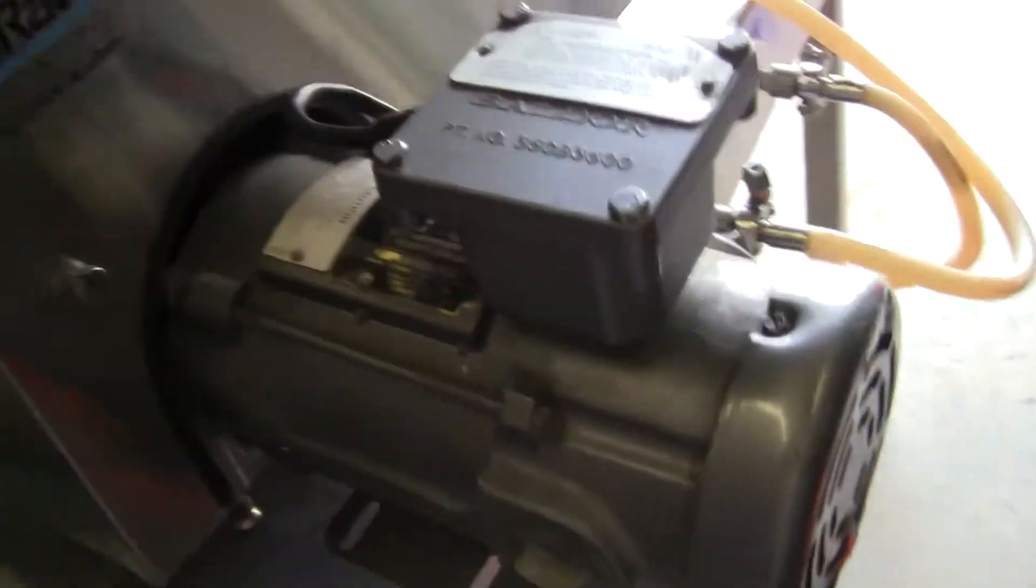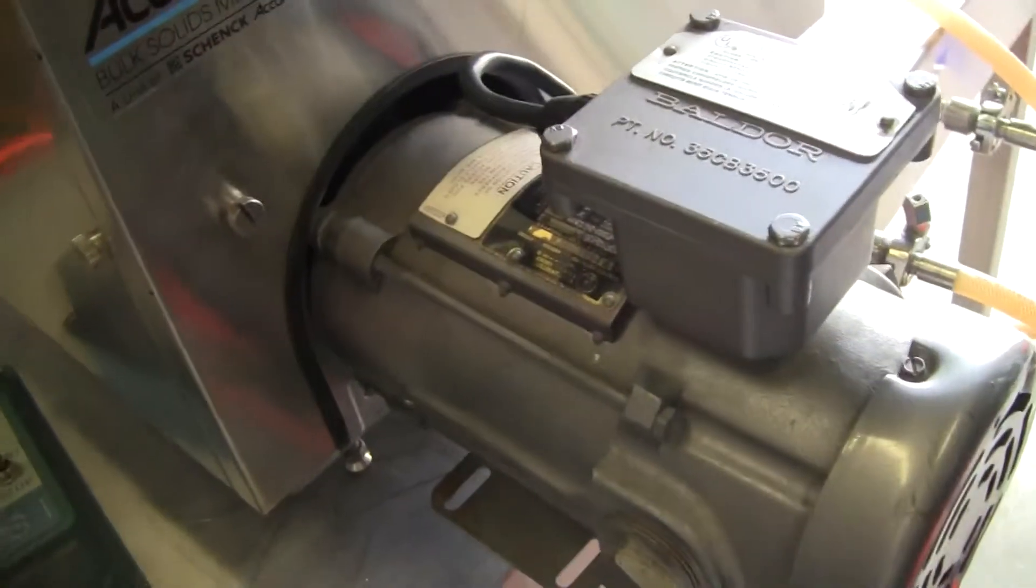The vibratory feeder is shaking, but if you do want this to be hooked up to an explosion-proof system, obviously you need to rewire this and get an explosion-proof motor controller.